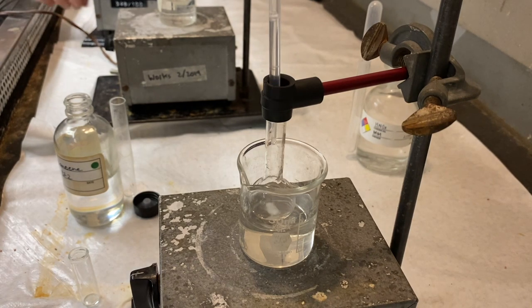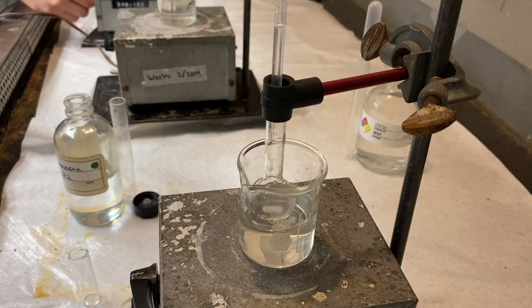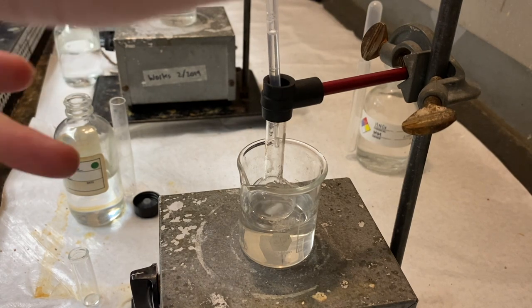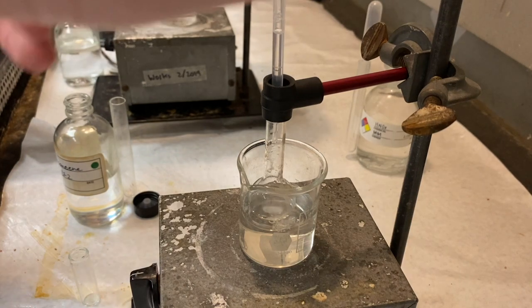And after we've added this, we'll wait a couple minutes. Make sure it's not getting too hot. And then we'll add in another half a milliliter. Repeat that process until we've added two milliliters of the bromobenzene total. That's four steps.